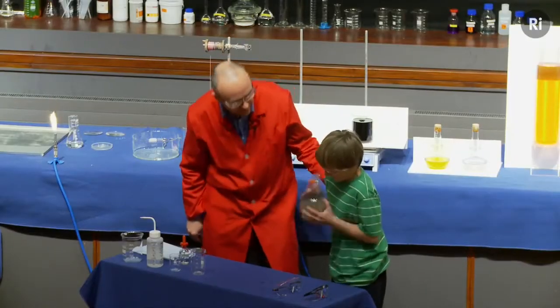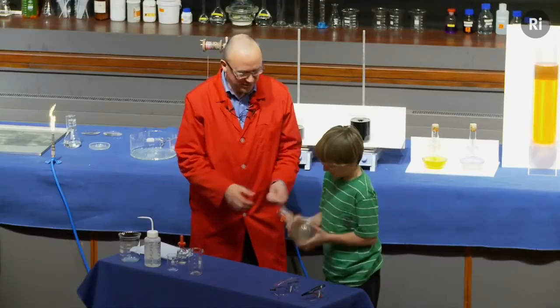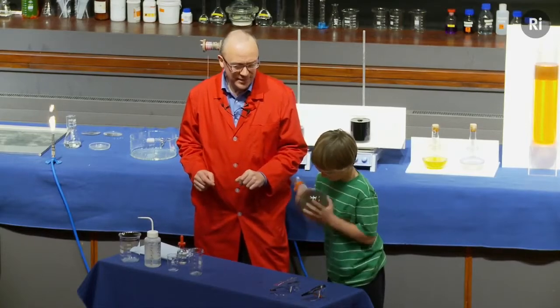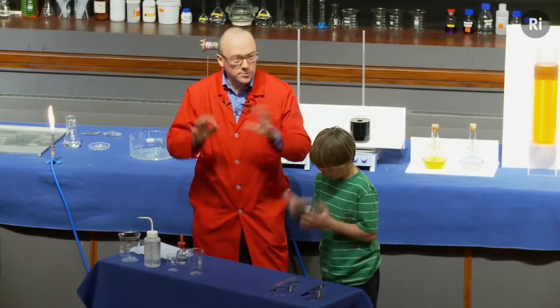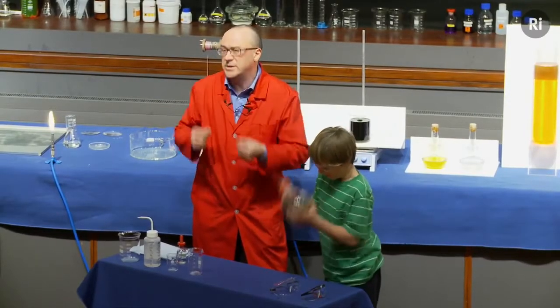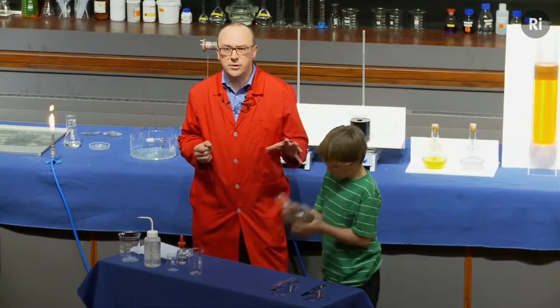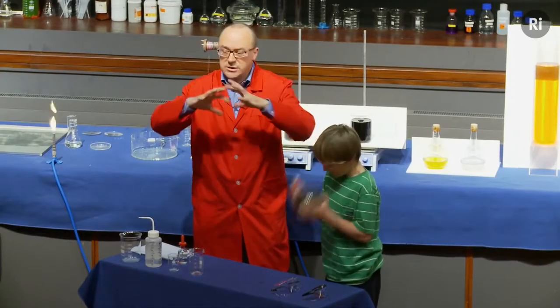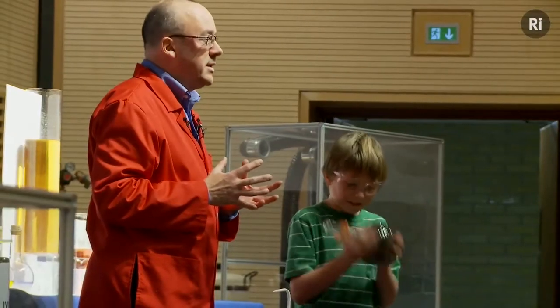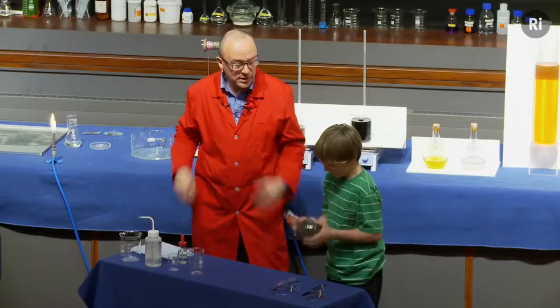It takes about three quarters of an hour. Is that okay? It does actually take a minute or two, but the harder you shake, the better it works. So keep shaking. Don't drop it, though. Okay, so silver metal is being formed atom by atom, and you can see it's all going quite black. That's because very finely divided silver is actually black in colour. What we're hoping is going to happen over the next minute or so is that those particles of silver will start to stick to the walls of the flask. And as they build up, we should see silver metal in the form of a mirror building up on the inside of the flask.